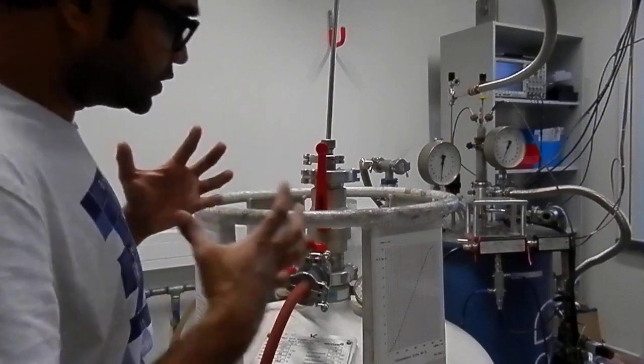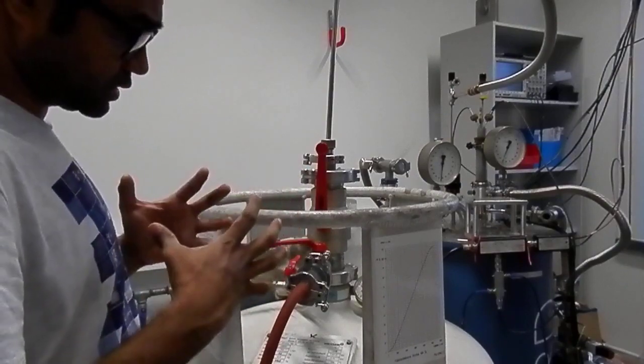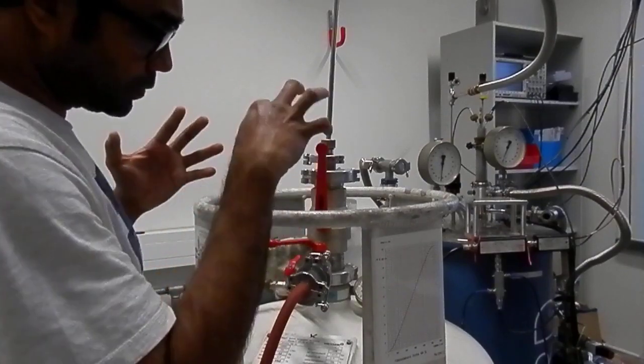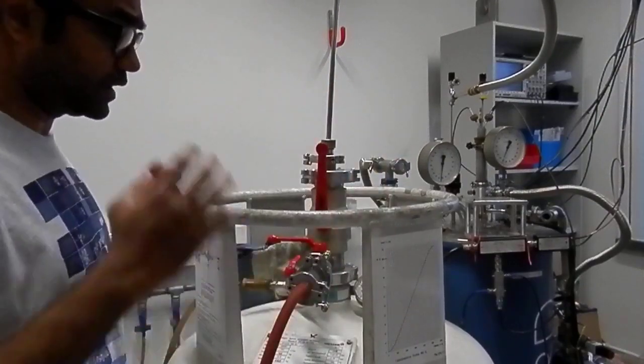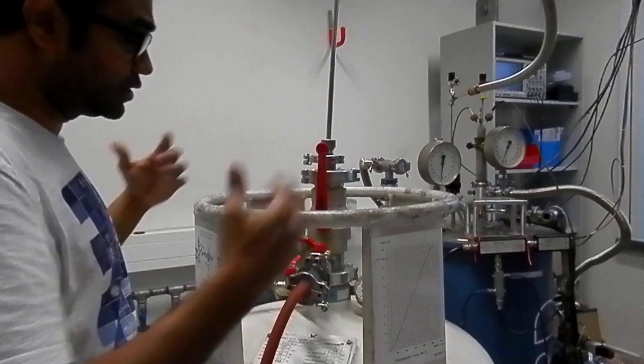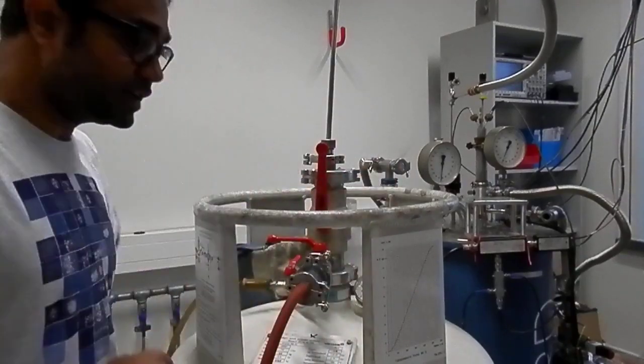But one has to really keep an eye on the pressure. It should not go very high, otherwise the transfer rate will be very high and it can be very problematic in general.